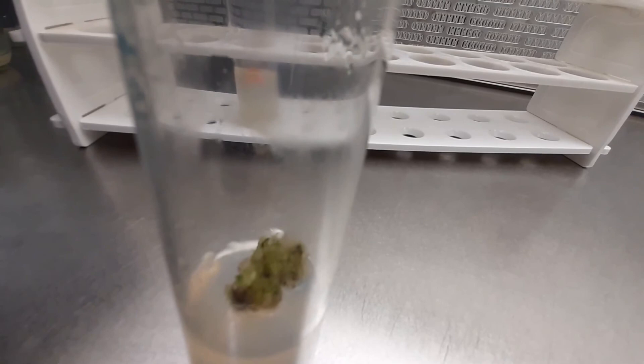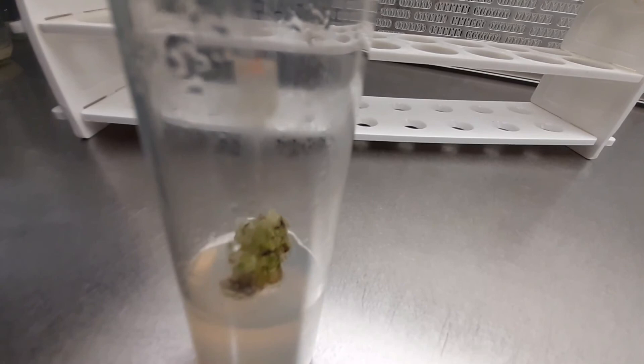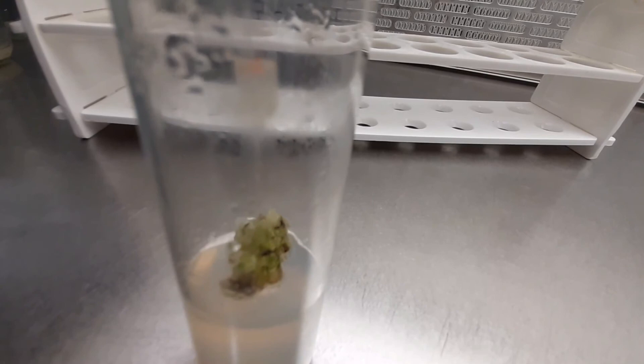This kind of undifferentiated mass of callus tissue has been developed in the test tube. You can develop any kind of callus tissue using the initial explant as leaf tissue, carrot explant, or other tissues as well.